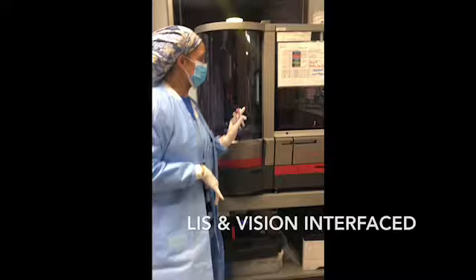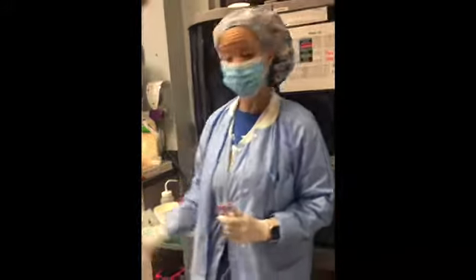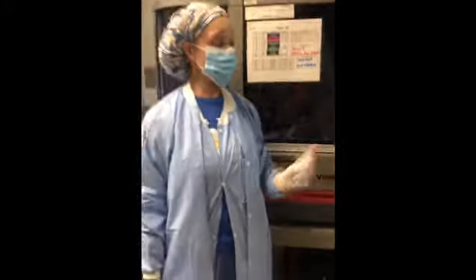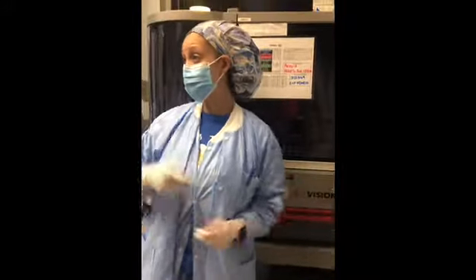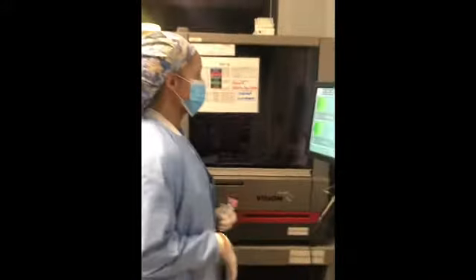LIS from the Vision to SunQuest. It allows the Vision to talk to SunQuest and transfer patient information from the Vision to SunQuest. All right.